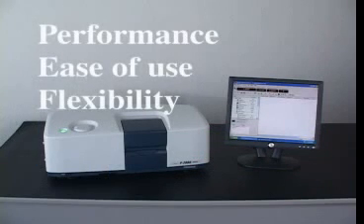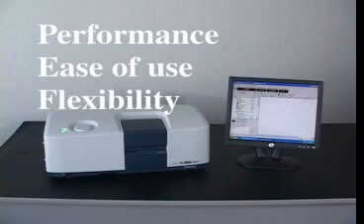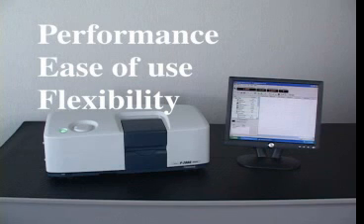For the ultimate in performance, ease of use, and flexibility, choose JASCO for your next polarimeter purchase.